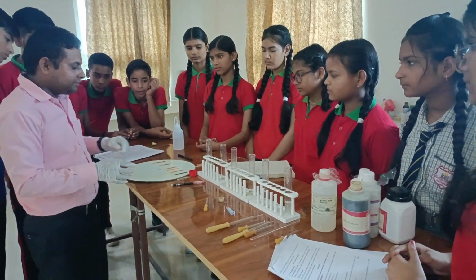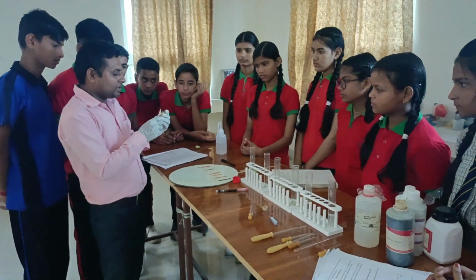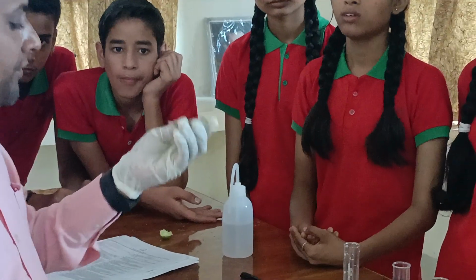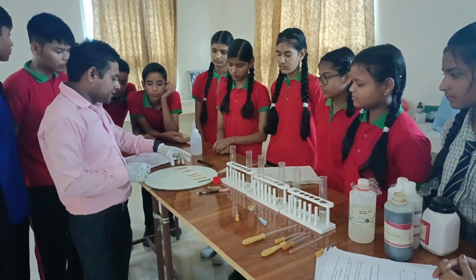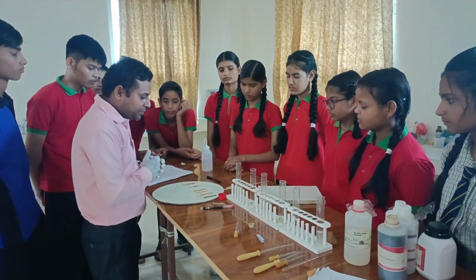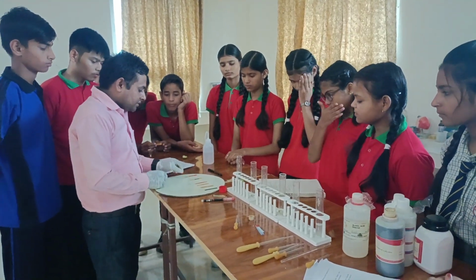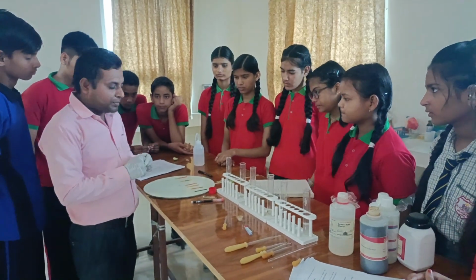So actually we need a chart paper having the value of pH and base. We have collected six pieces of pH paper and we dropped some amount of solution on each one.